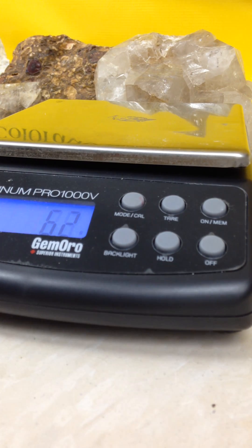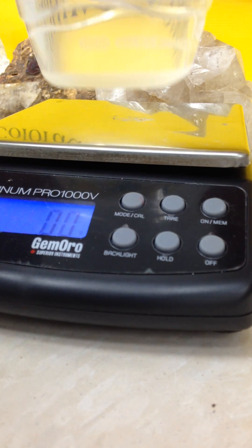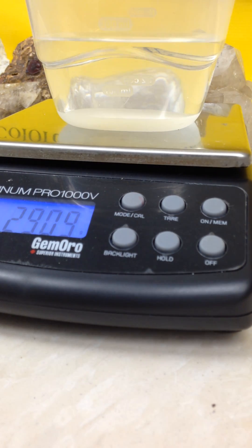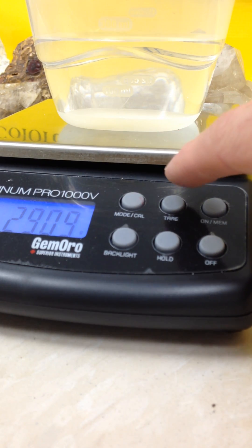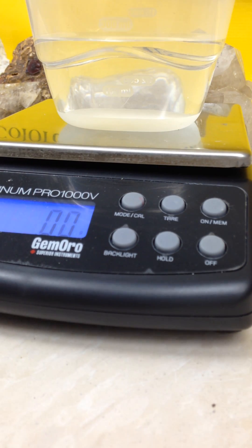Then remove your mineral and put your container with water on it, and if you hit the tare on most scales, it will bring it to zero.